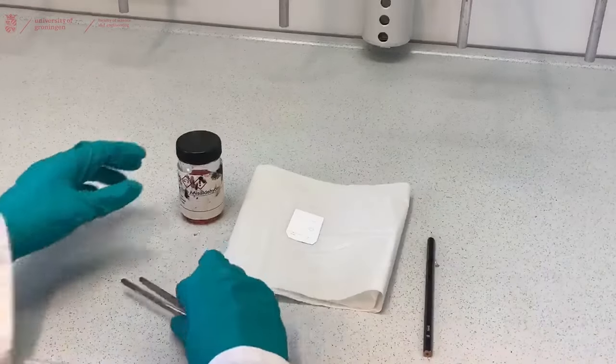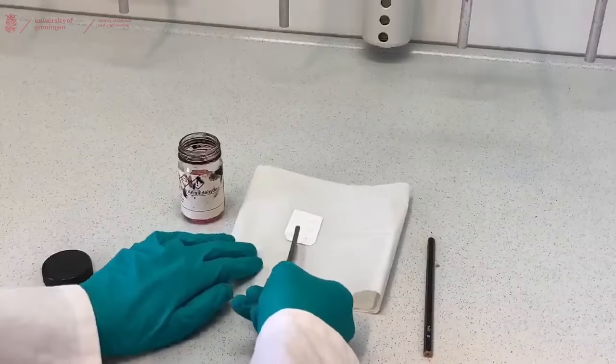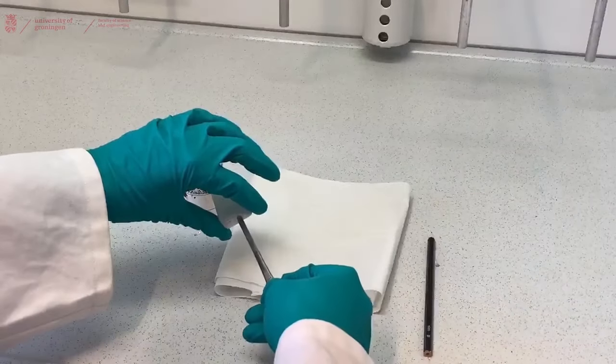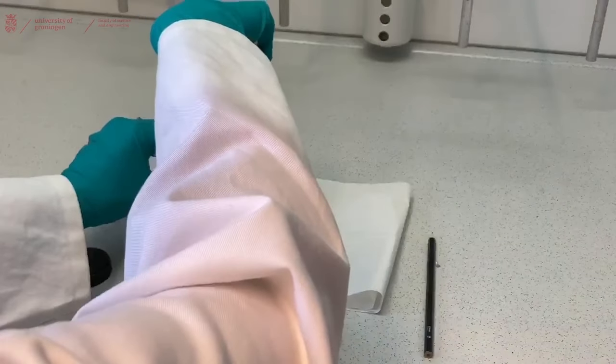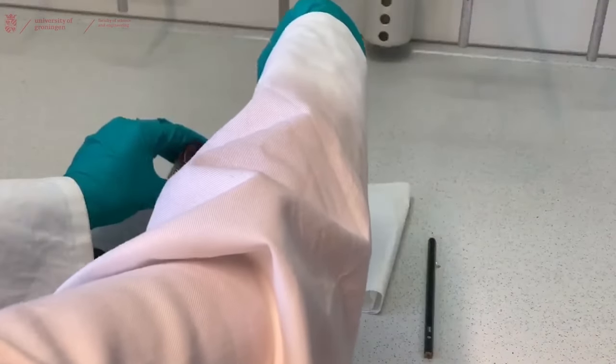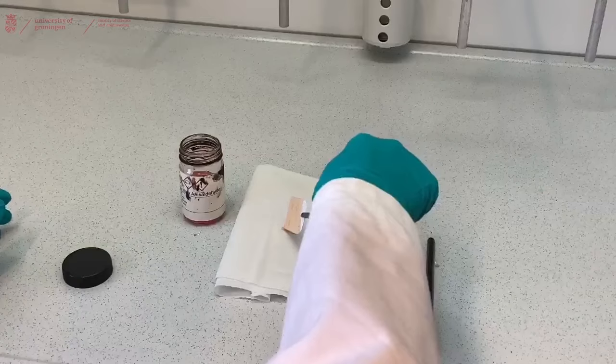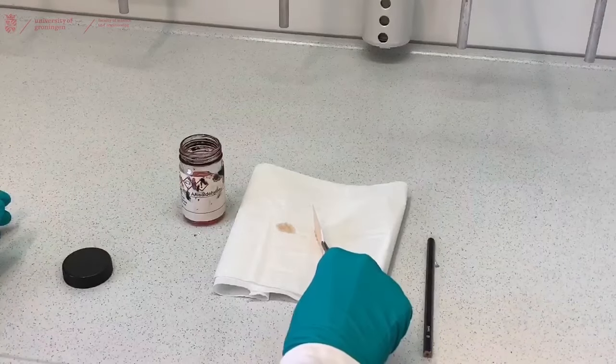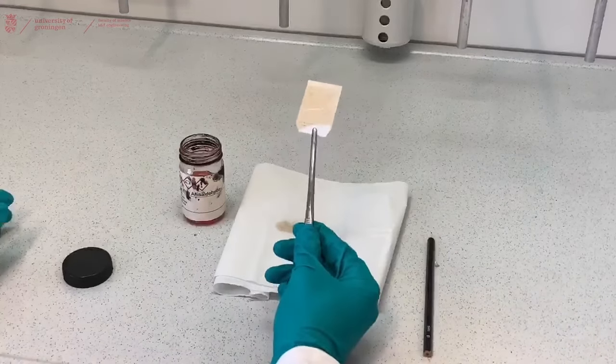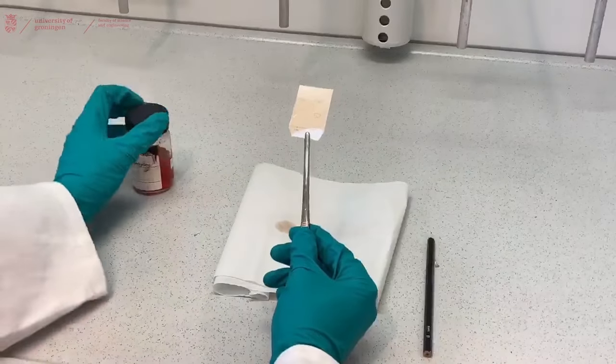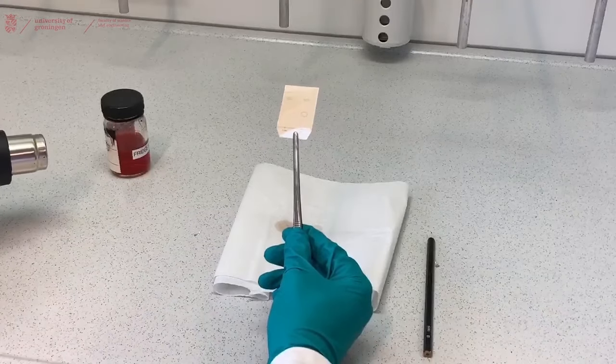Carefully dip in your TLC plate. When you removed your TLC plate from the stain, you carefully remove the excess liquid that might be attached to your TLC plate.